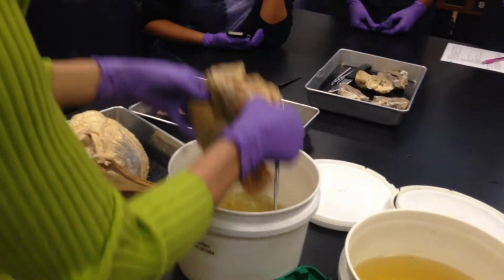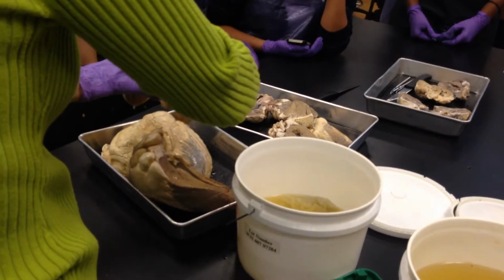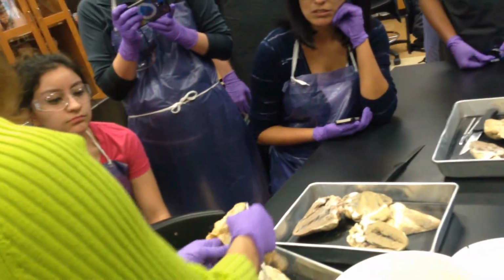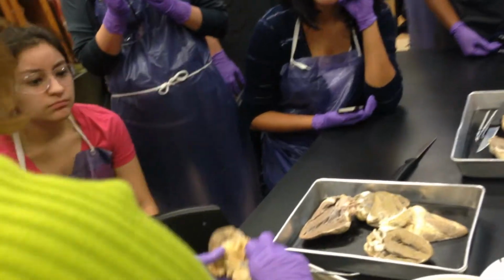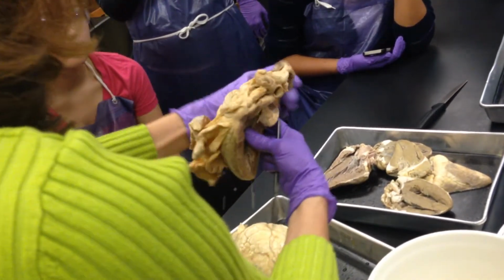You'll use that to find your structures. And beautifully here, I forgot, we had also put here, this is a sheep heart, but identify this structure right over here. What is all of this right here? On top, can everybody see the heart? So this goes like this.